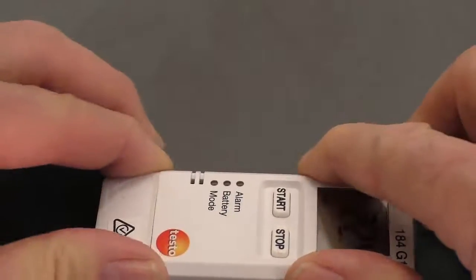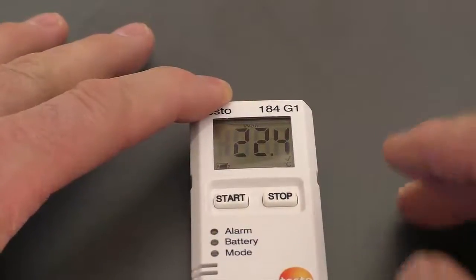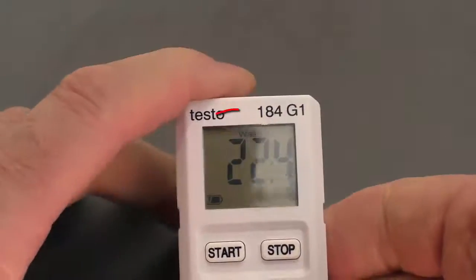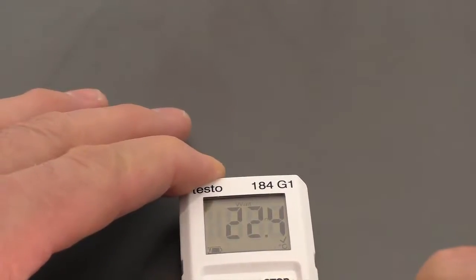I remove it from the PC. Now we could have copied that configuration file to other instruments — exactly the same start-up file — to configure multiple units. At the moment, the display on this instrument says the word "wait", which means it's waiting for an input to start because we set it to a button start.